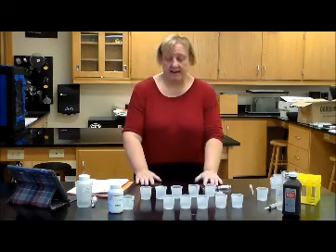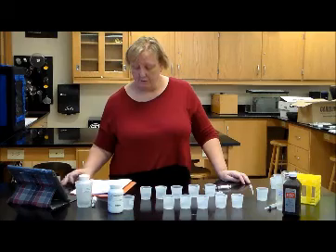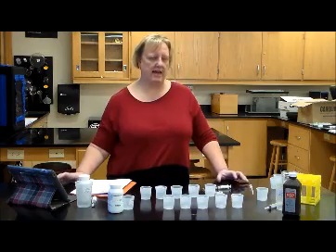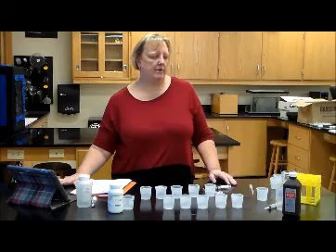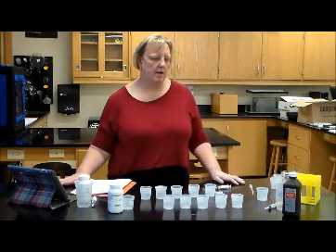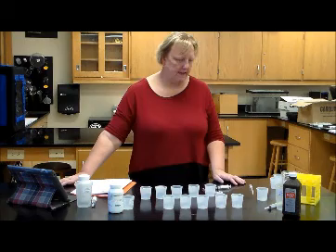The lab is divided into four parts. In the first part, you will do some basic testing of hydrogen peroxide and catalase just to see what kinds of reactions take place. When hydrogen peroxide breaks down, it breaks down into water and oxygen. The oxygen is going to form bubbles, so one of the reactions that you're going to look for is whether there are bubbles or not.